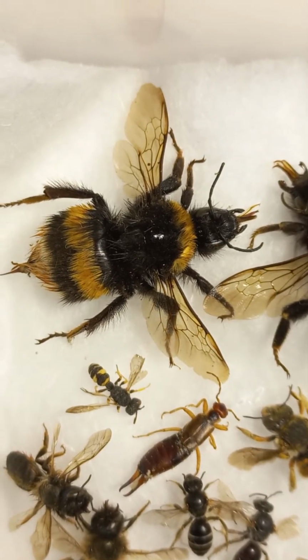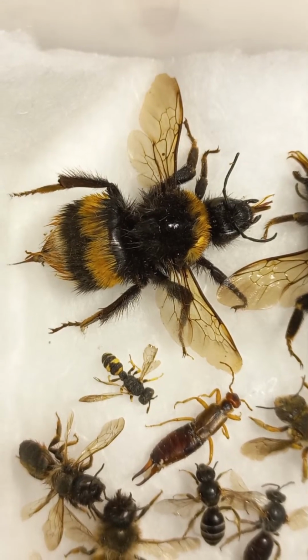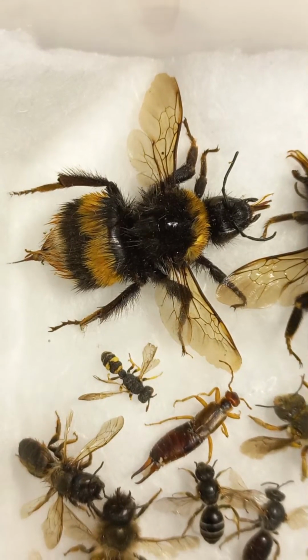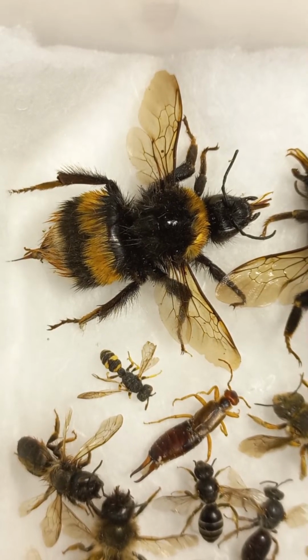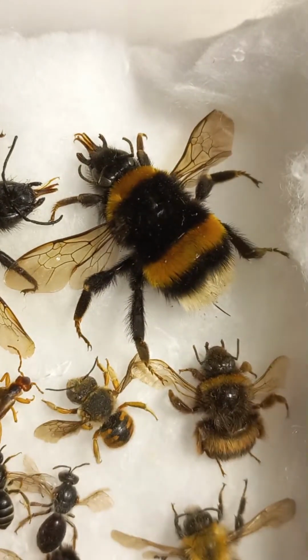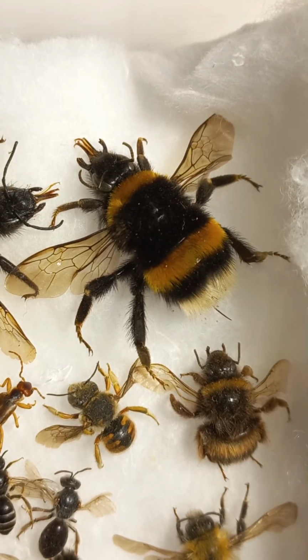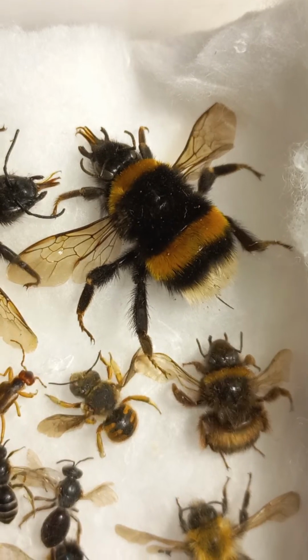Here with open mouthparts, with mandibles, with open proboscis, with antennae and head forward. And you can even see some details of the sting, which is pretty long, about 4 mm. This species is called Bombus terrestris, queen. And this is Bombus terrestris as well. I especially opened the mandibles to show their structure. I opened the proboscis to talk about its details. And I just made the sting extended, so you can see the sting of the queen.